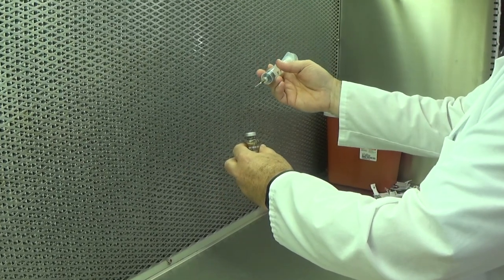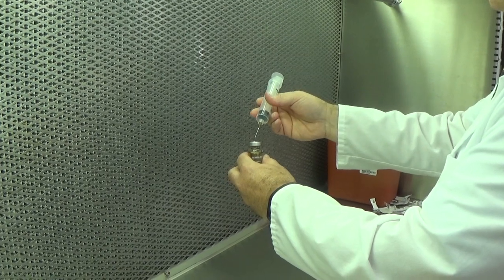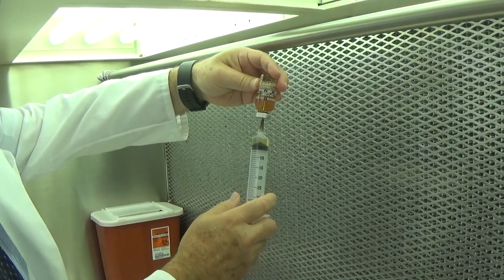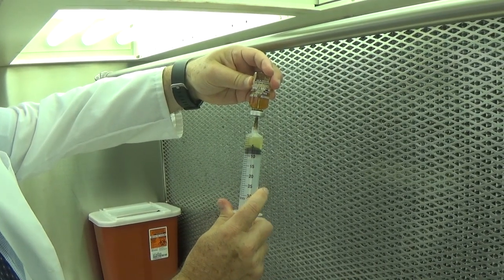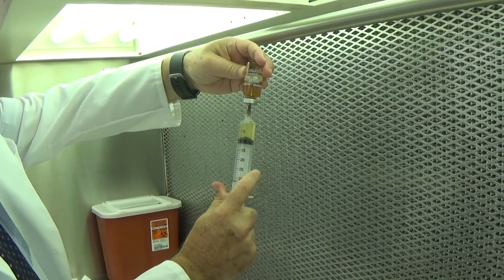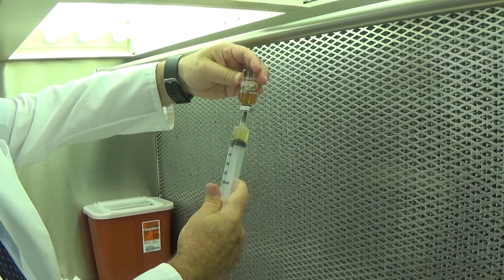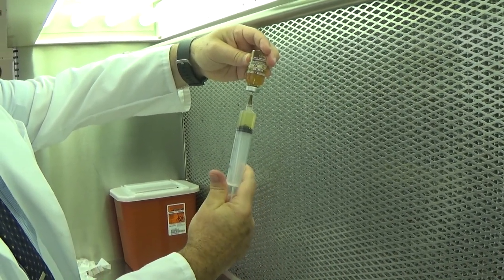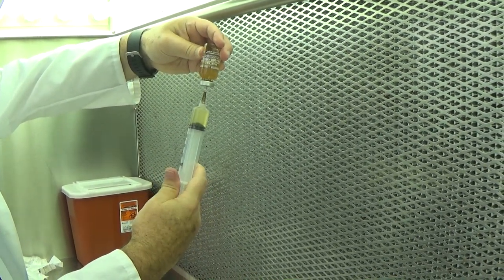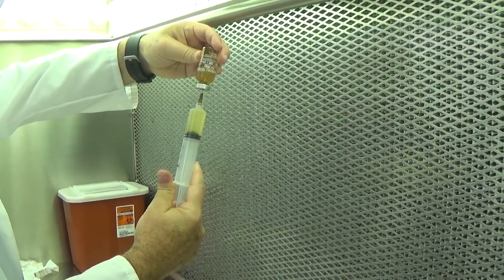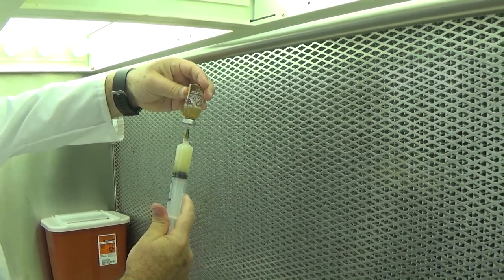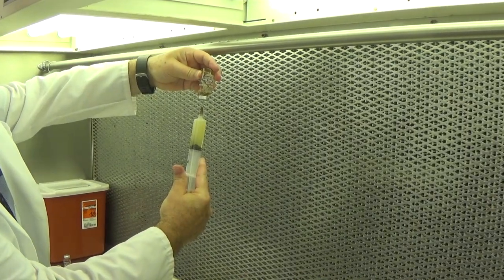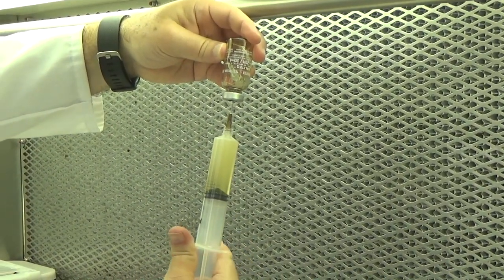Now that it's dry, I'm going to insert needle and syringe into the vial and draw the contents of my reconstituted powder using the same technique. Always pulling, never pushing pressure into the vial. And there's my 20 milliliter dose.